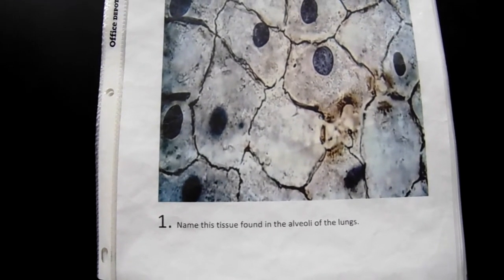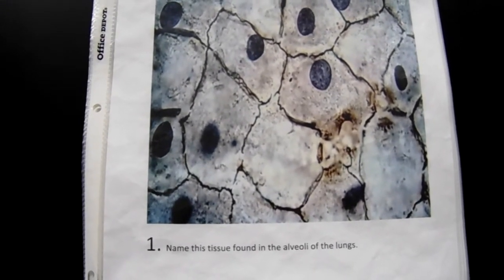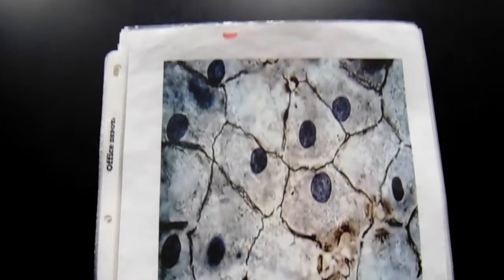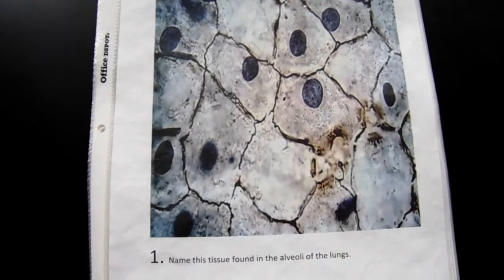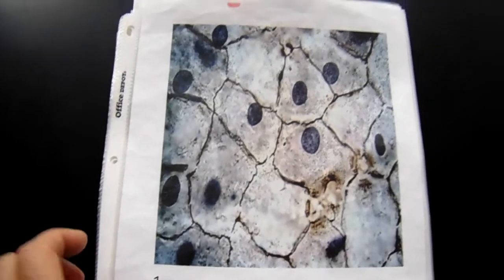This first tissue is simple squamous epithelial. It lines our heart valves and heart chambers. We have 50,000 miles of blood capillaries made of this tissue. It has one nucleus. It also lines our alveoli sacs in our lungs where we can transfer oxygen to our blood capillaries. So very distinctive, simple squamous epithelial.